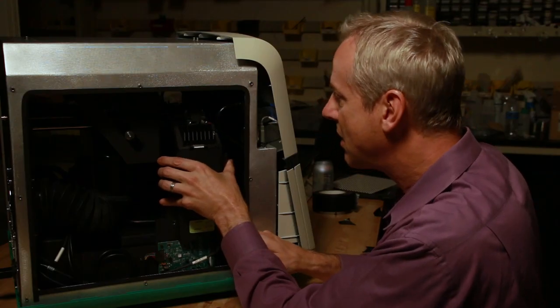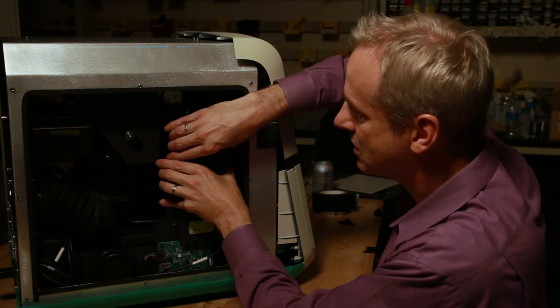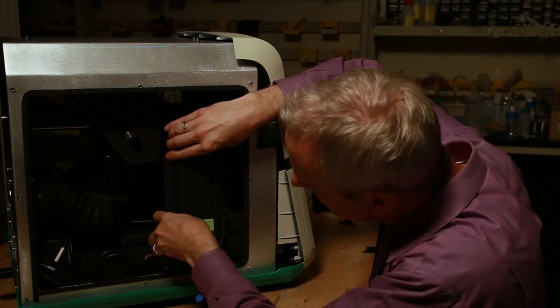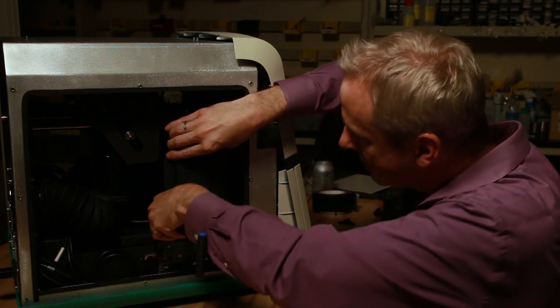We ended up needing to have LEDs made that did not exist, and have some custom filters and reflectors made to allow us to get the performance that we needed. With a camera-based imaging system, filtering is challenging. You have light coming in from all different angles. You have this big image sensor that you have to protect from all this stray light. It's a challenge.